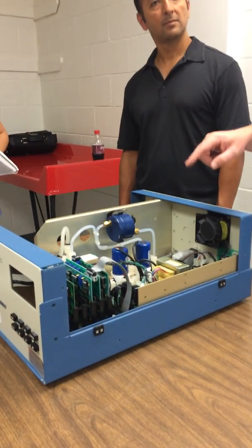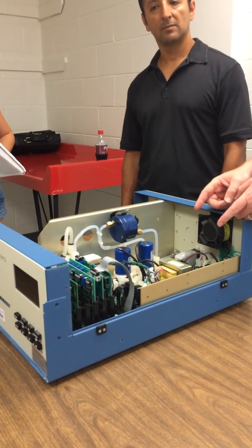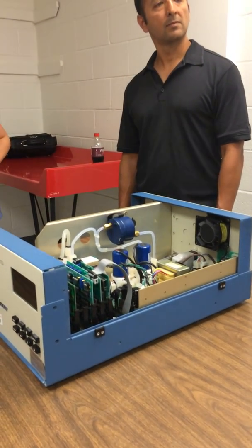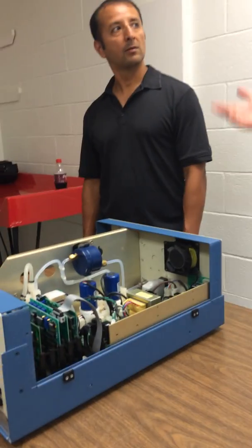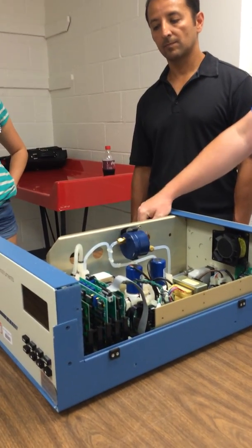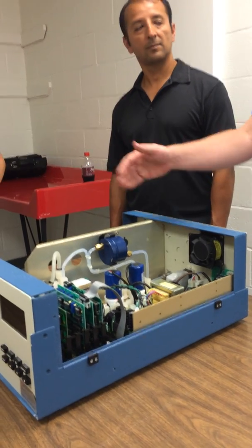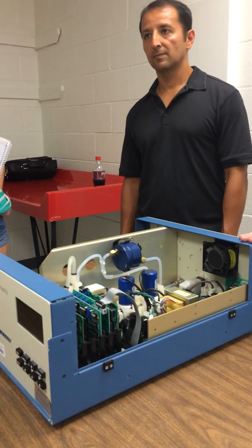That uses the same lamp. The only difference is that the one up here that generates the ozone does not have the coating on it, so the mercury emits at 254, but also at, I think, 185 nanometers, and the 185 nanometer is more like what you get up higher in the atmosphere that creates the ozone layer. That's how they make the ozone. The lamp over here for the detectors has a coating that filters out the 185, so you're only getting the 254 line. That's so we can make the absorption measurement but not worry about making ozone in the cell.